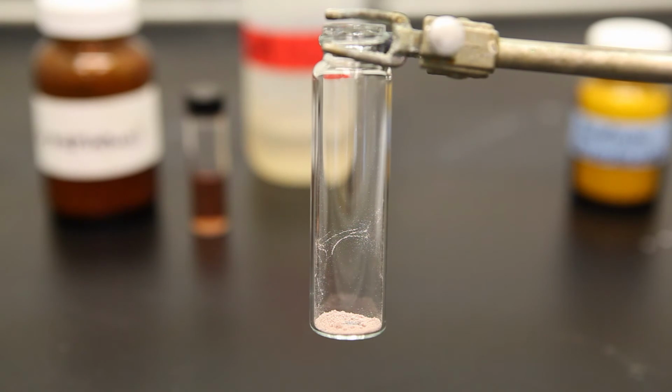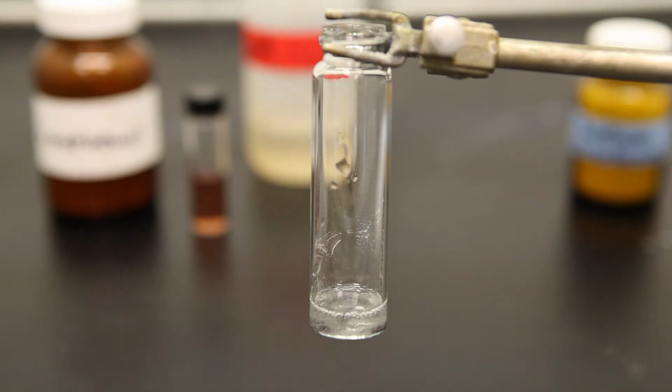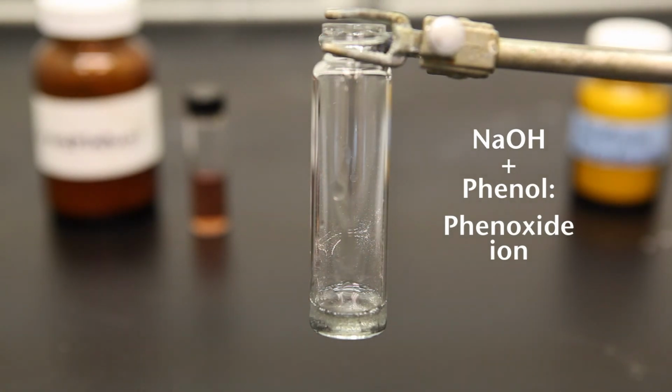Upon addition of sodium hydroxide, we notice that there's a reaction, as a phenoxide ion is being formed. Once we add hydrochloric acid, we notice the precipitate falls out.